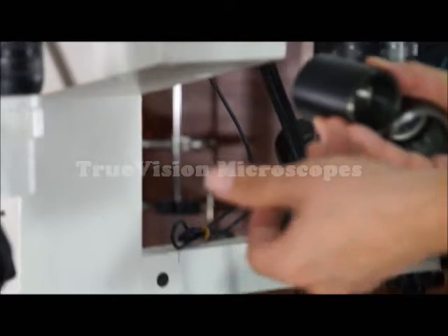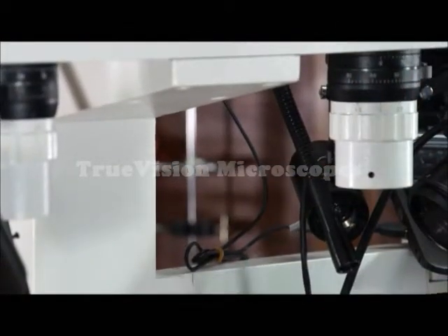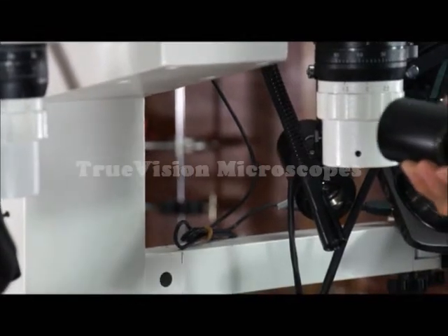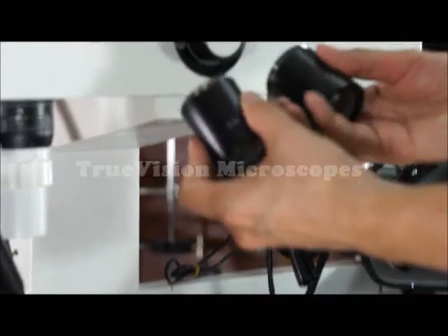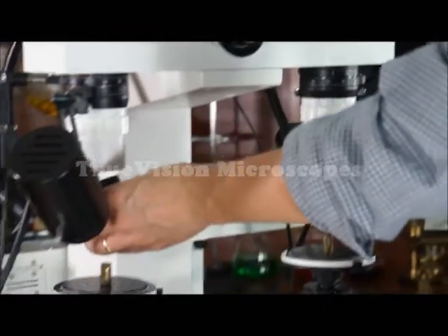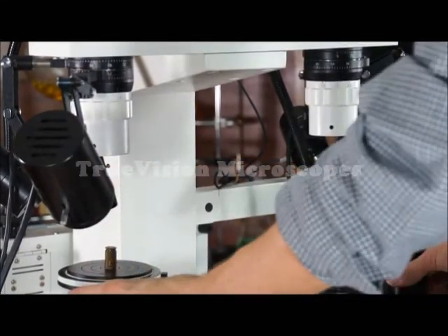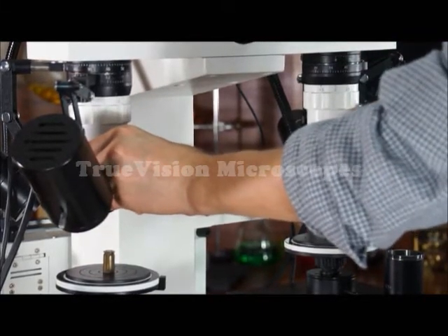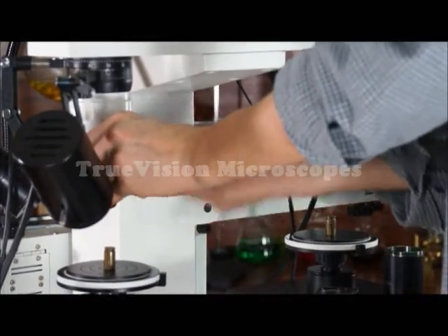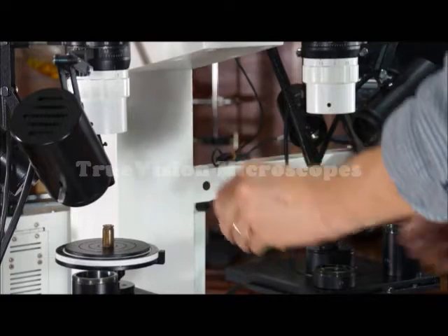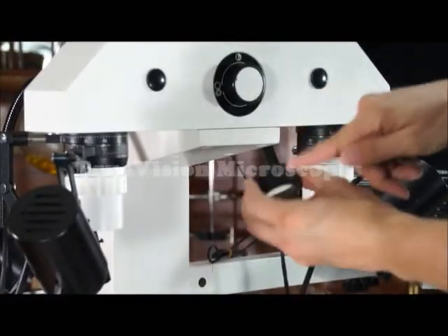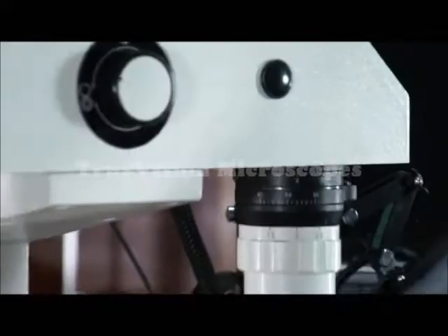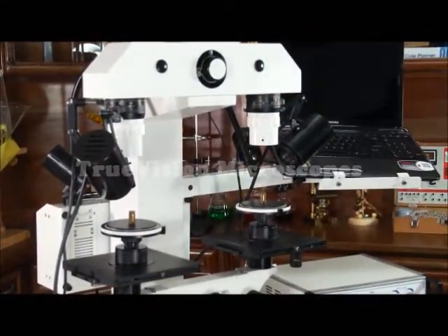Everything on a comparison microscope comes in pairs. So you have a 2x objective, 2 of them, and you have 2 of the 0.3x objectives. They screw to the bottom of the zoom objectives. They will change the magnification, and they will also change the working distance. The working distance is the distance from the bottom of the lens to the specimen. So a 2x magnification doubles the magnification power, and a 0.3x magnification is 0.3 of the magnification.